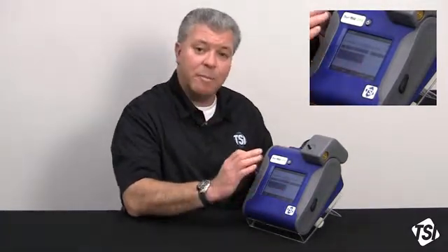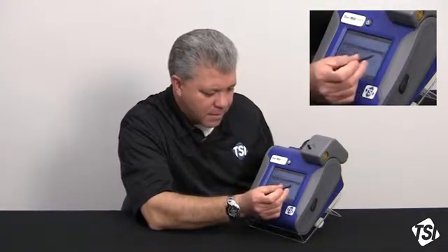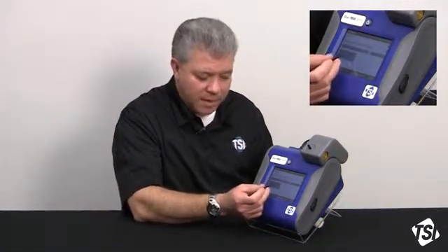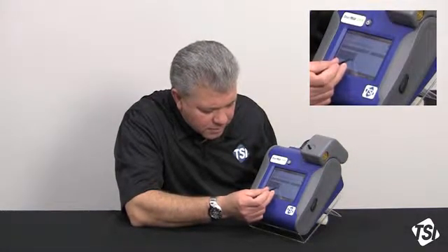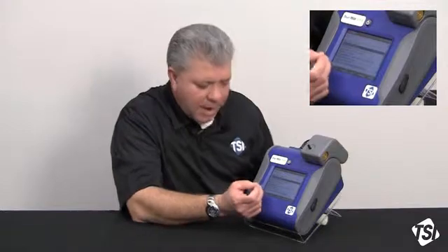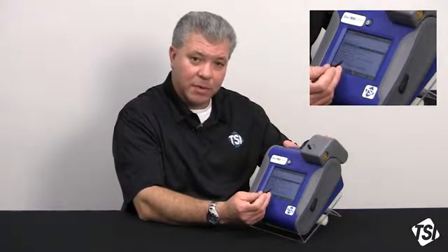Now I can have more than 2 minutes. I just can't have less. So it wants me to set that. Setting that, I'm going to scroll back down, and now what is the frequency or the timing that I want to input into the instrument so that it zeros during sampling? Let's say we want 6 hours. So I am going to toggle this down to 6 hours, right like that. I'm going to hit set. And now I have turned on the AutoZero module function. I have set an AutoZero interval at which the instrument will AutoZero itself during sampling.